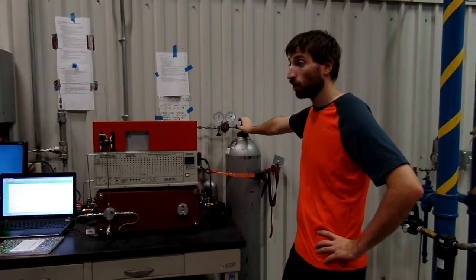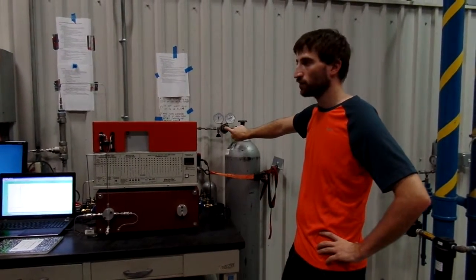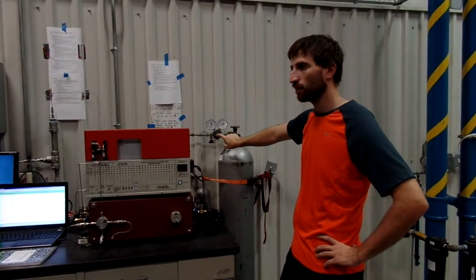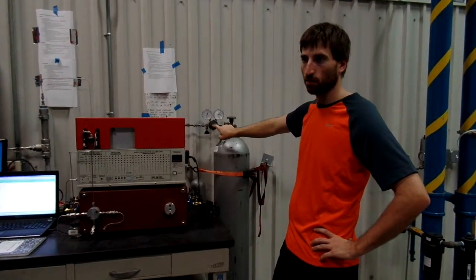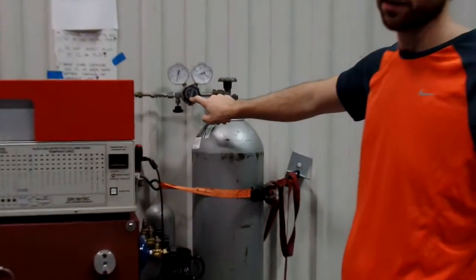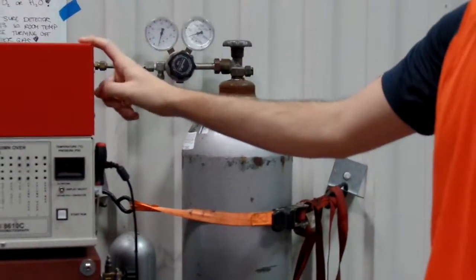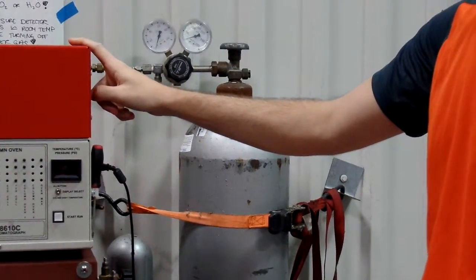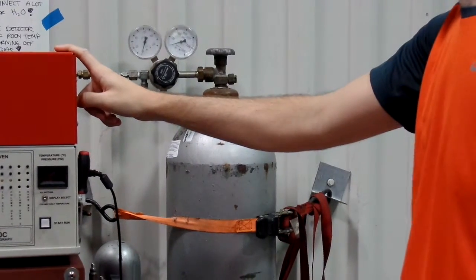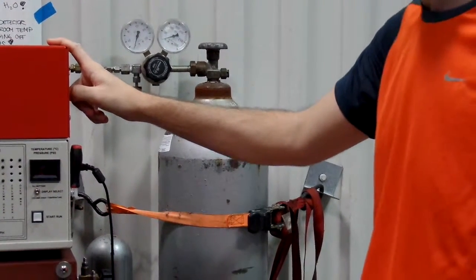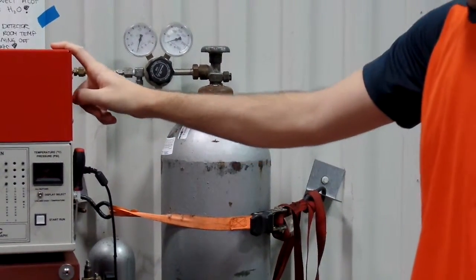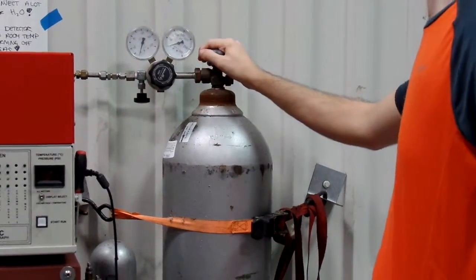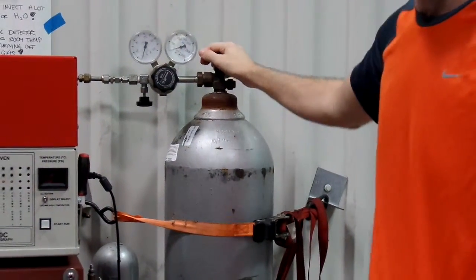Argon tank. It's off. Alright. Do not adjust this. This does not move. This is already pressure set for what needs to go in volume wise. What is it set at? I don't know. We'll see when you turn it on. Check it out. Anyway, I'm not going to turn it on. There's no point.